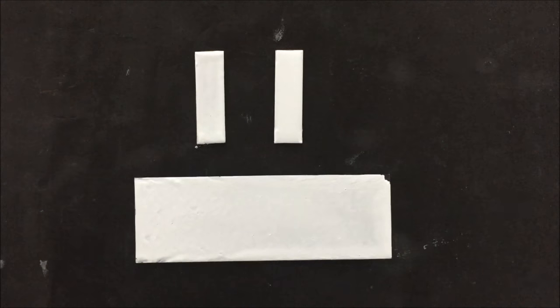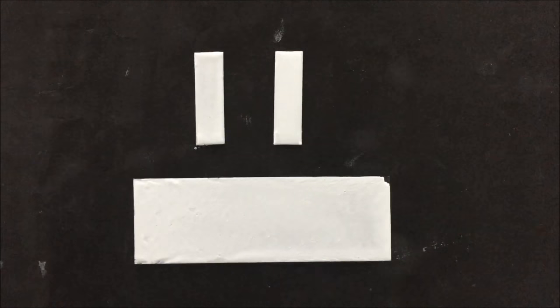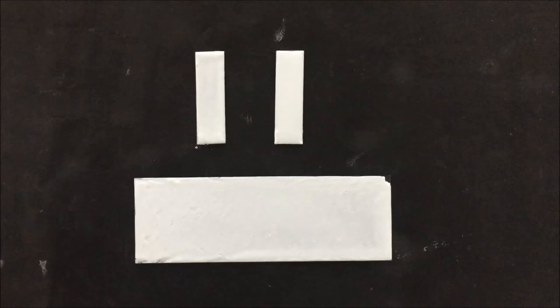You can also store these plates, protect them from moisture, and you can use this plate within 3 days. Make sure that at the time of use, activate the TLC plate again.